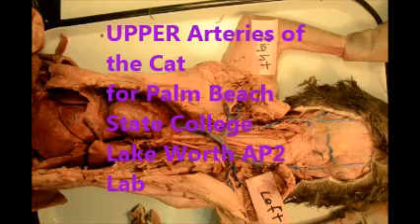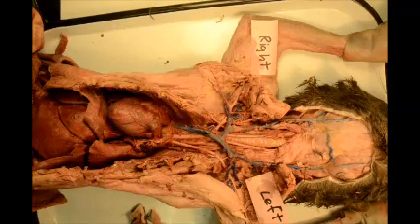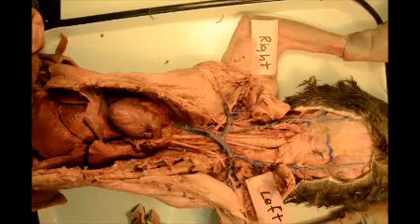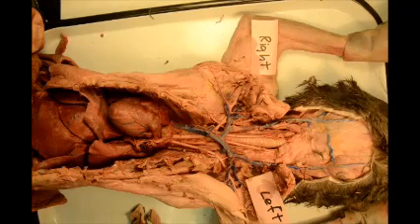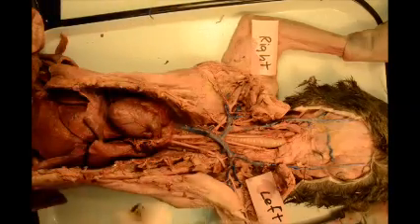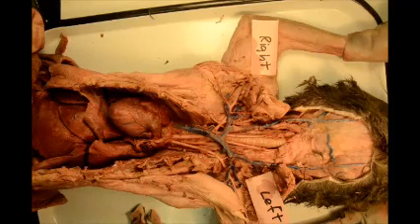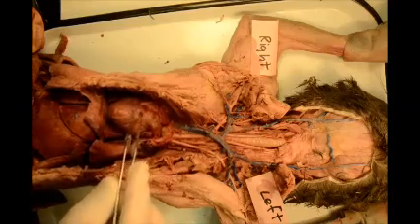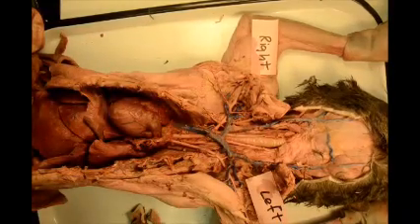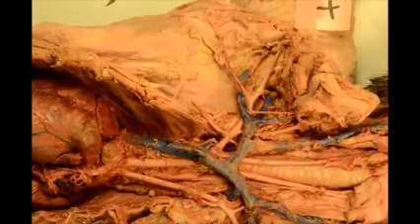Here's a video on identifying the arteries of the cat, specifically the arteries in the upper part — the thoracic region. We start by locating the anatomical position of the organs. The right side and left side are labeled here — and we're talking about anatomical position of the cat, not of the spectator. Here is the heart. We will zoom in and start to identify the arteries of the thoracic region.